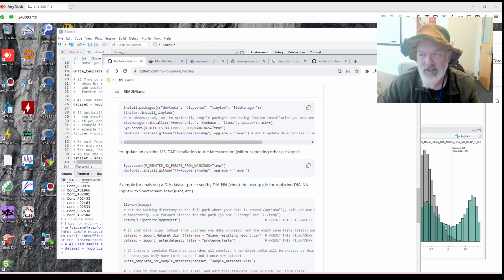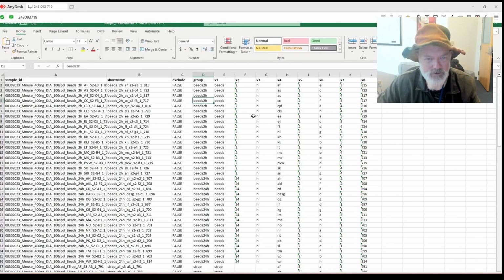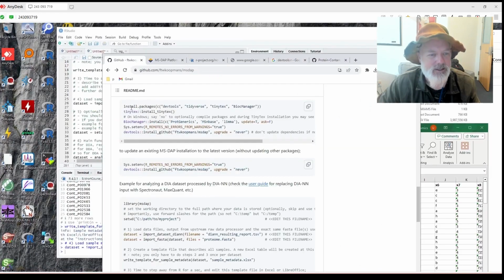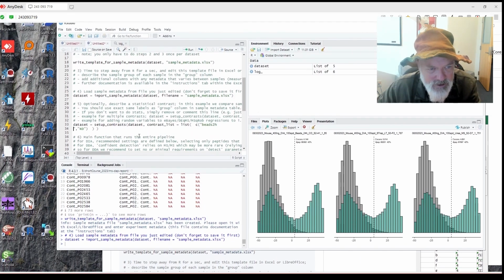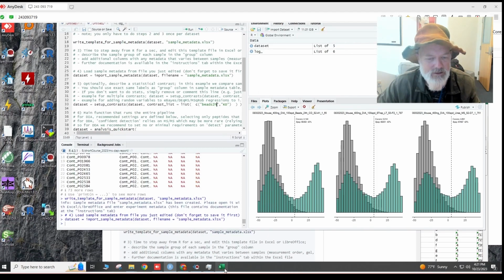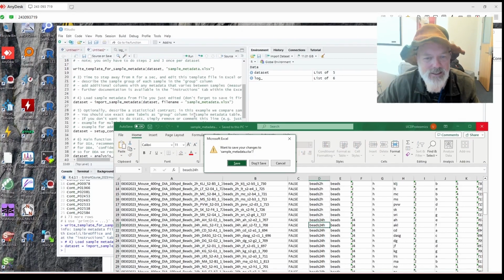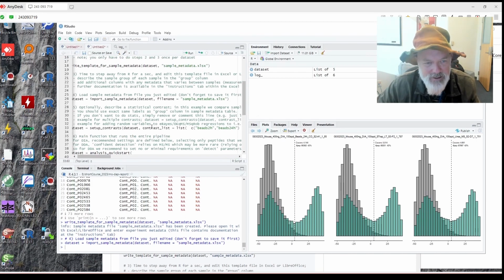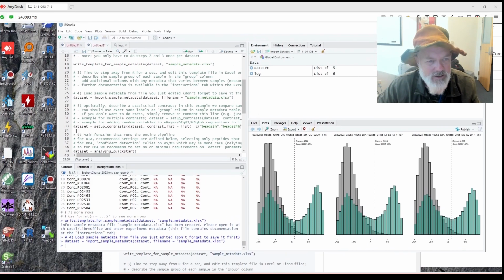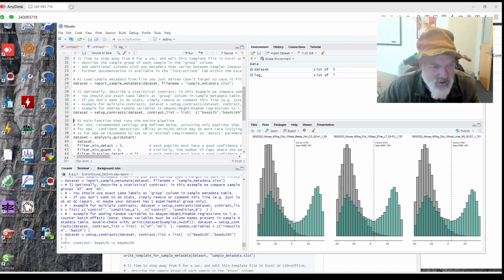And the contrast we're going to do is the beads 2 hours versus the beads 24 hours. So we set that here. So beads 2 hours. And beads 24 hours. And this is all case sensitive and it has to be exactly right. So that's why I copy pasted. Okay, so data set of contrast. All right, so now it goes to the next line.